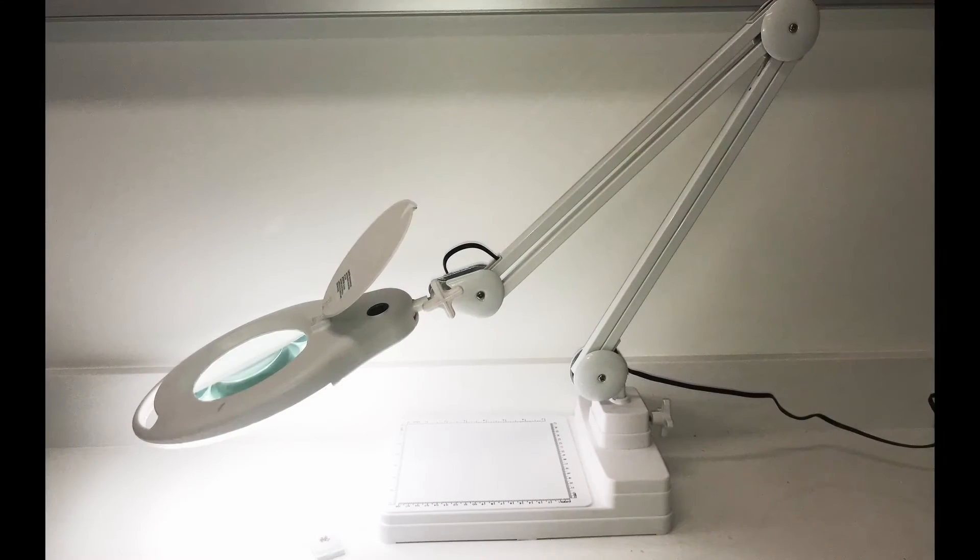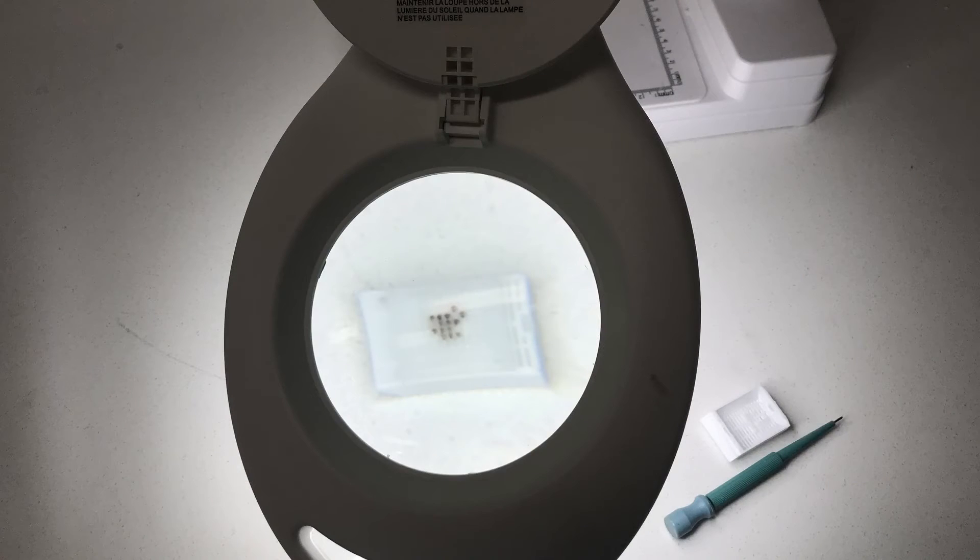I would highly recommend a magnifying lamp if you're punching inserting cores because they're a bit hard to see over time.